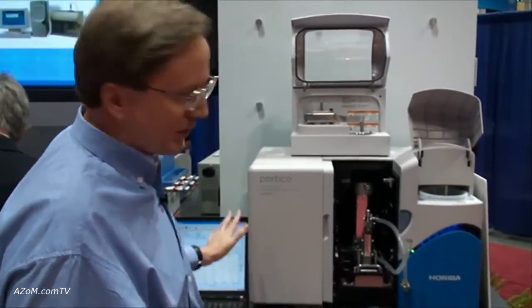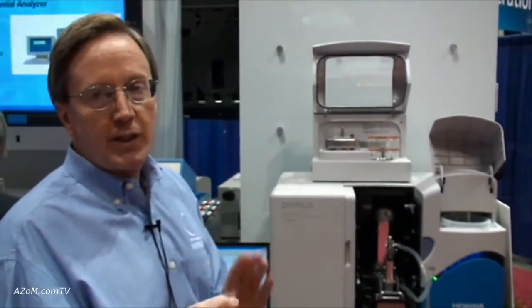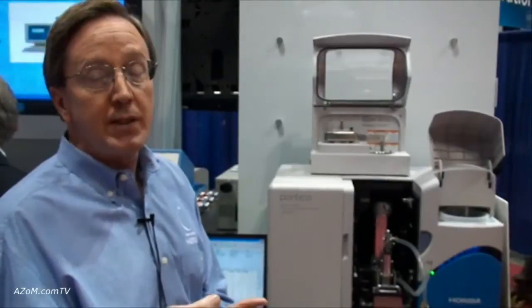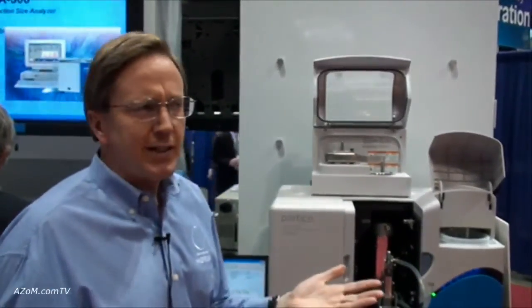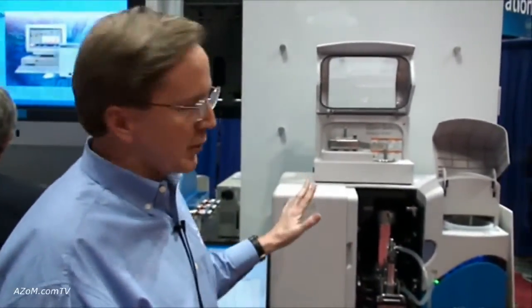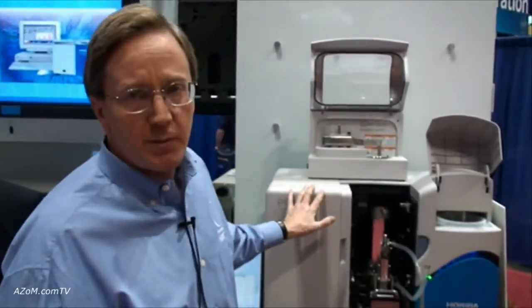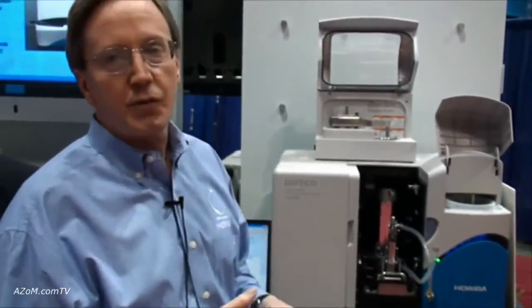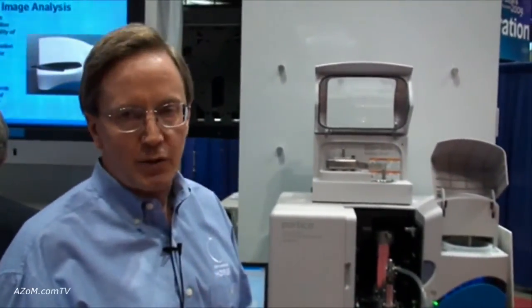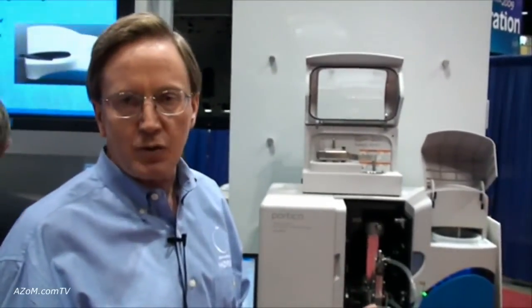It's a very simple, easy system to use — powders and suspensions, with a dynamic range from down near 30 nanometers up to 3 millimeters. It's probably the most popular unit for all kinds of industries: pharmaceutical, chemical, cement, and food. If you're going to buy one particle size analyzer for your lab, this is what you want to buy first. From there we have many other specialized tools for specialized applications, but this is really where you usually start with particle characterization in your laboratory.